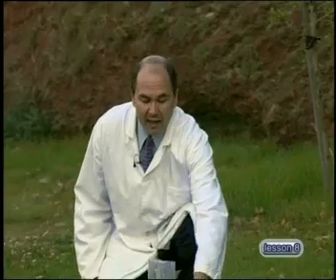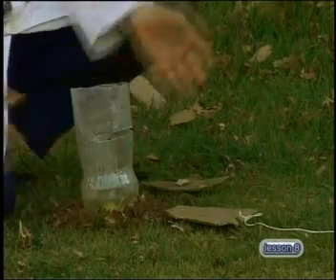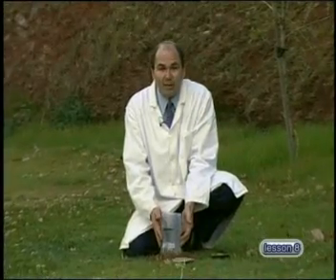I've come outside because the reaction of group 1 metals and acid is extremely dangerous. So I've taken some special safety precautions. The first thing I've done is I've taken some card and I've attached a very long string to it. Then in the old plastic container, I've cut a slit and I've placed acid in the bottom of it.